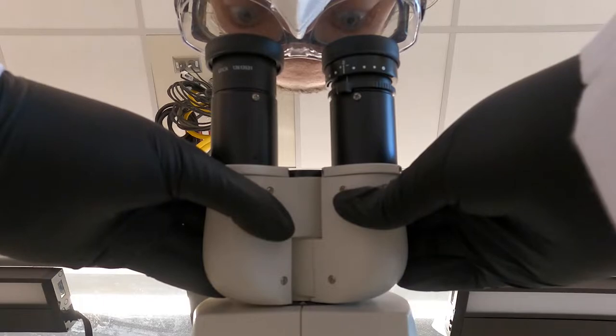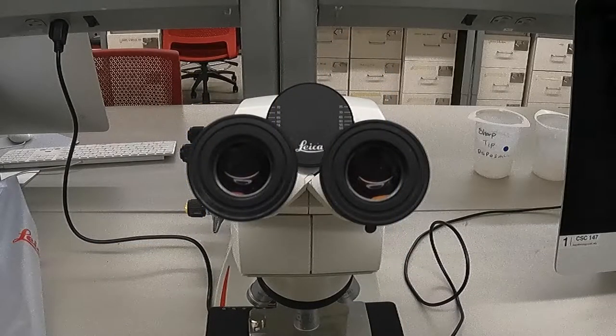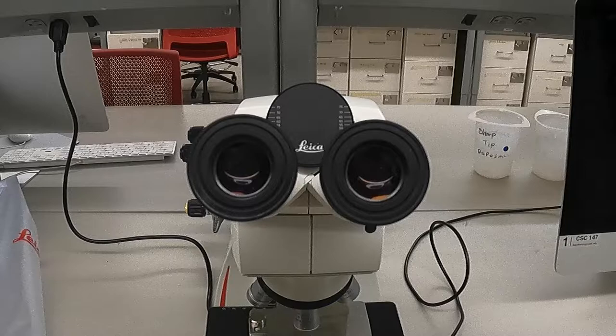Additionally, since variations in vision between eyes can exist for a given individual, each eyepiece can be independently adjusted from the other to allow for optimal clarity. If this adjustment is needed, please ask your TA for more information.